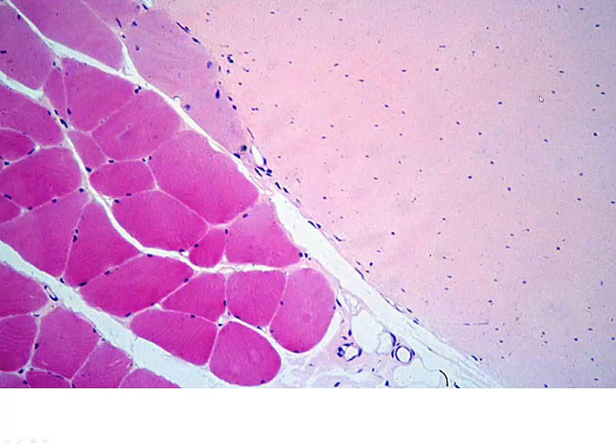But in our tendon, we no longer see those nice elongated nuclei because we're cutting them in cross-section. They're just little spots. But we see no space whatsoever. We're looking at the cut ends of parallel arranged collagen fibers. And so when you just have this homogeneous field, so sparsely consisting of cells, that's one way that you could determine that we're looking at a cross-section of dense, regular, collagenous tissue, and that will be tendon. We pretty much can extrapolate that we're looking at tendon because of the close association with muscle. Ligament would look exactly the same, it's just the interconnection of bone to bone.